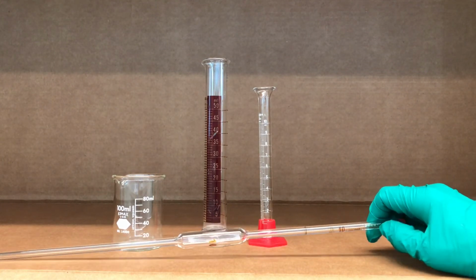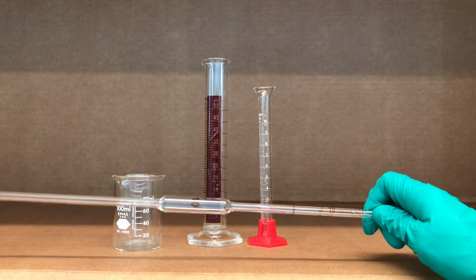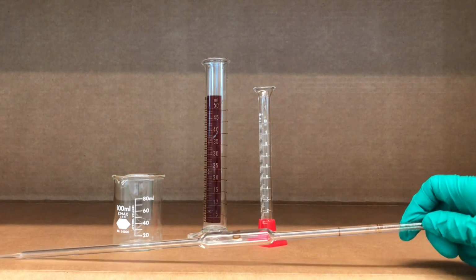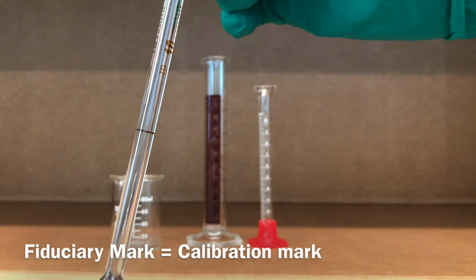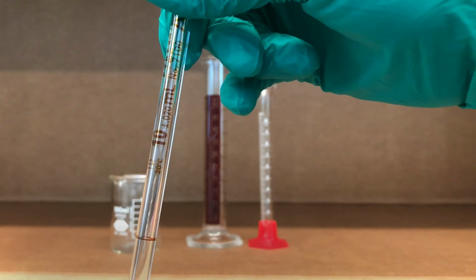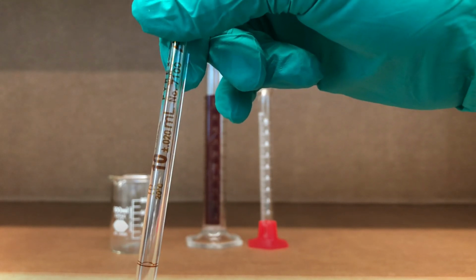We also use, when you're doing analytical chemistry, you want to have very exact amounts of things, and I've chosen a 10 mil pipette here. These are engineered such that they contain exactly 10 mils. When you fill this pipette to its fiduciary mark, to this mark here, and pipettes also often show you how accurate they are, and this one is showing us that it's accurate within 0.02 milliliters, much more accurate than, say, a beaker or a graduated cylinder.